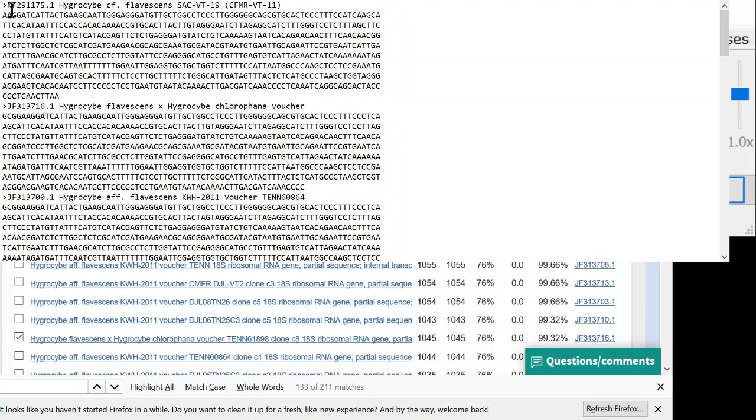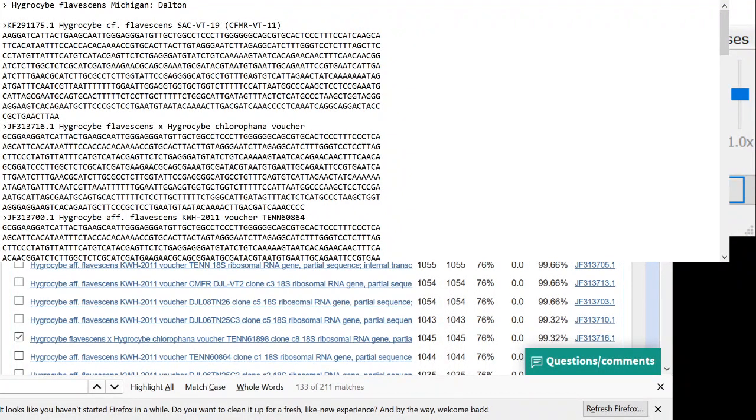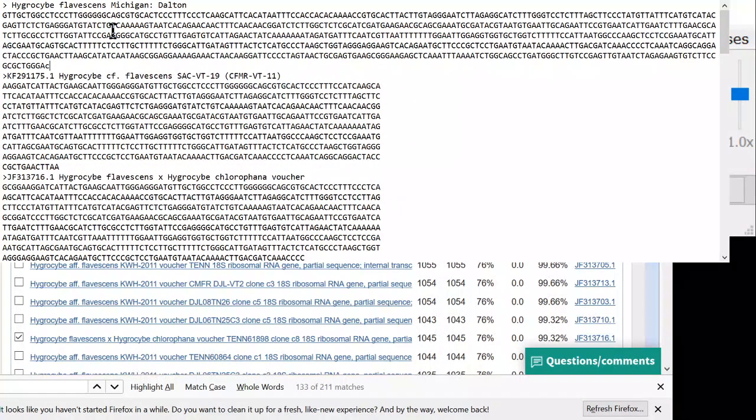What's not in this file yet is the sequence that I just generated, because I just submitted that to GenBank and it won't be in there for a week. So I need to add in my sequence. So on a new line, just up at the top, we'll do our greater than sign, and this is Hygrocybe flavescens, and this is when I collected in Dalton, Michigan. And throw that back on the clipboard. Over here. And okay. So that looks good.